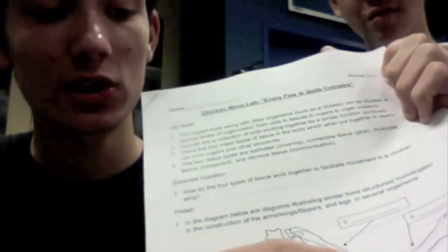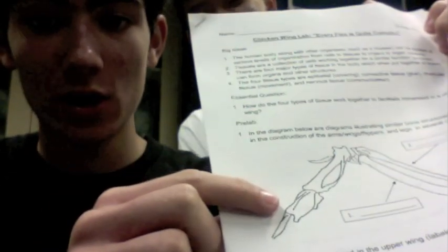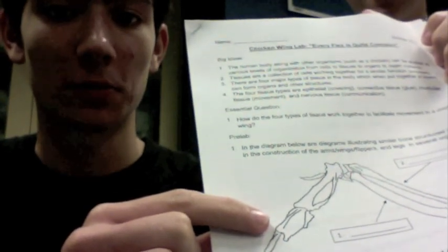Over here we have the humerus, we've got the ulna right there on the bottom, and the radius on top. This part here is the equivalent of the wrist bone to the chicken. These bones are all present in humans, as John will show you in his arm.